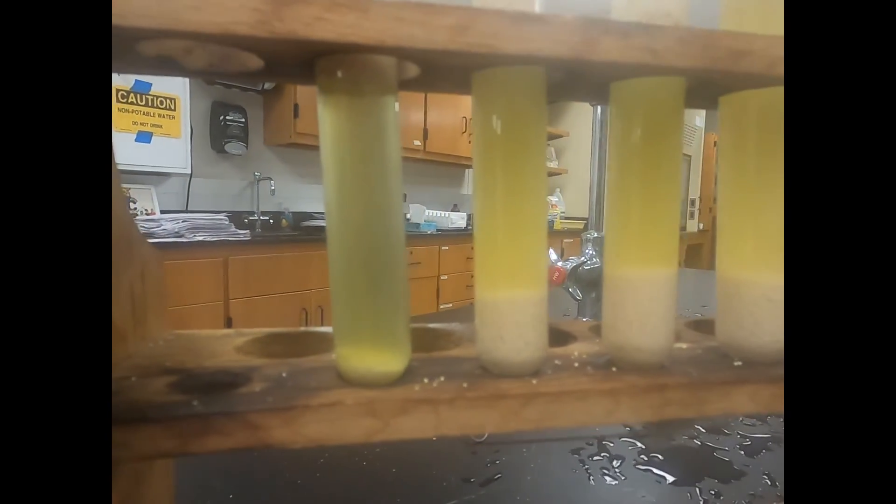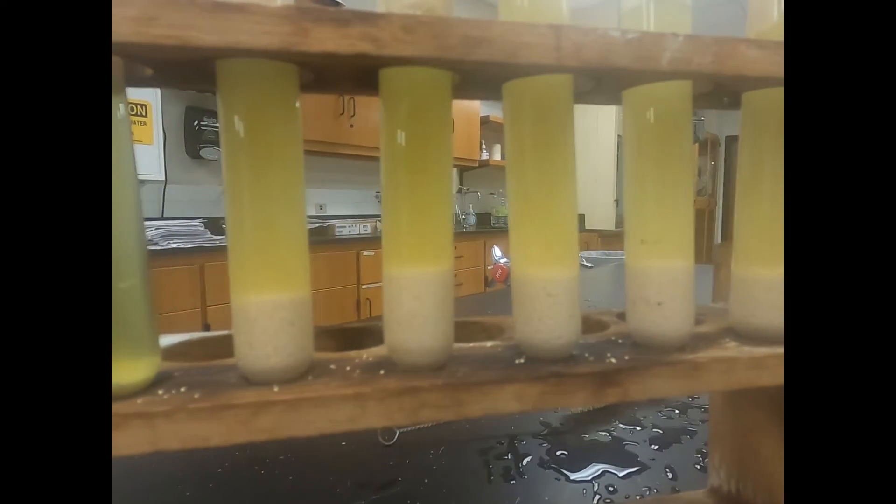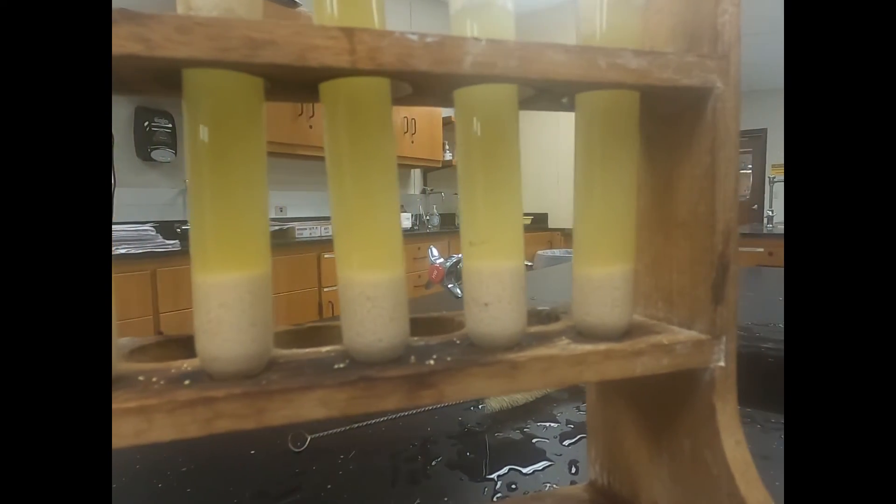Here's our zero, five, ten, fifteen, twenty, and twenty-five drops.